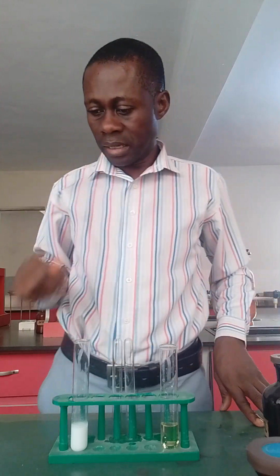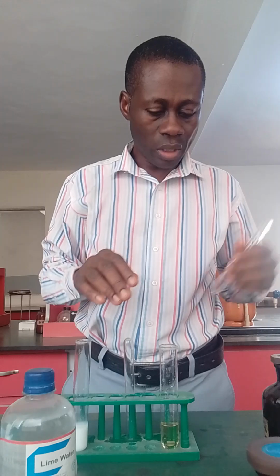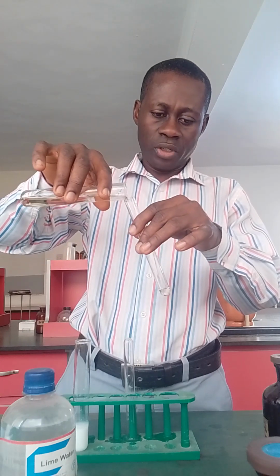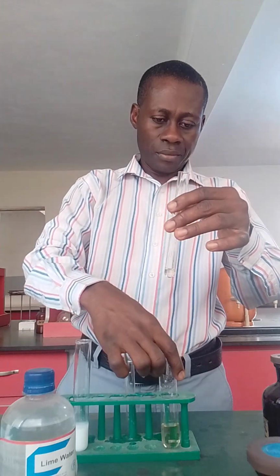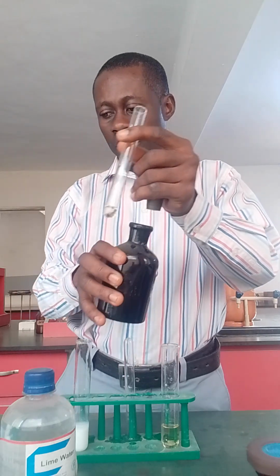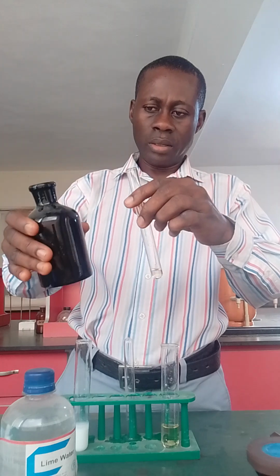All right, now let's do another one, the one that could evolve gas. I want to test for CO2 gas, so I get a little portion of the filtrate, small portion of the filtrate. I want to see gas. So what I will do, I will add dilute HCl.